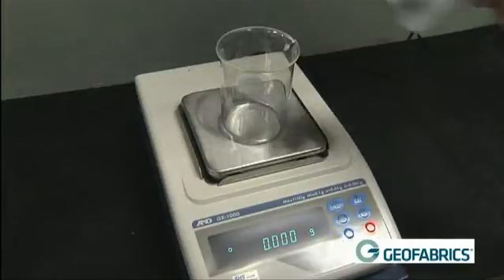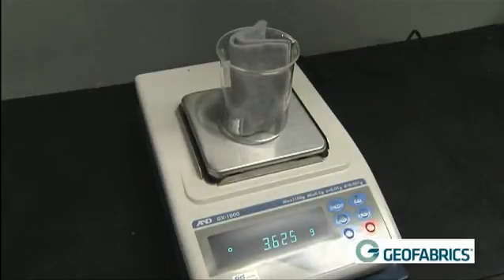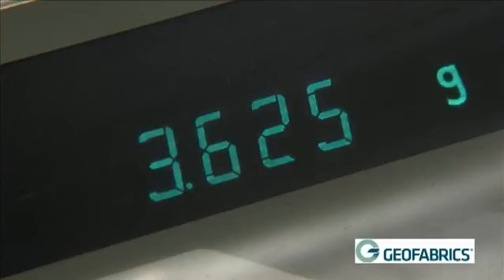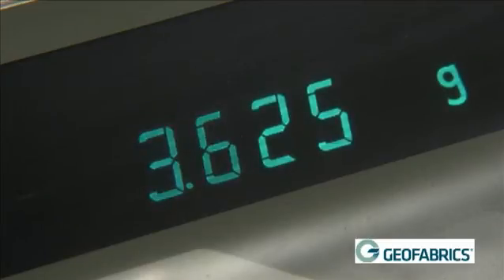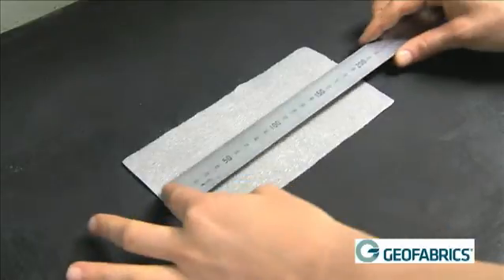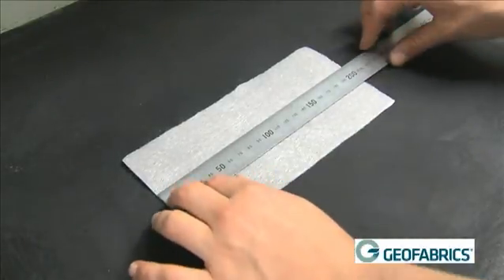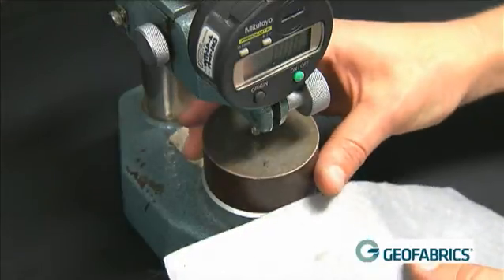For the mass per unit area to be calculated, the rectangular specimens are placed on a balance and a reading to 0.01 grams is taken. The specimen is then measured using a ruler and the width and length of each specimen is recorded to the nearest half a millimetre.